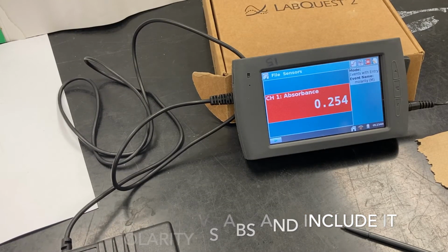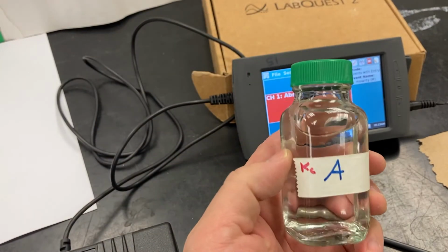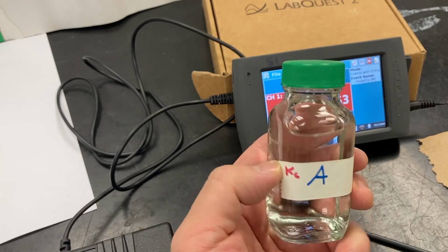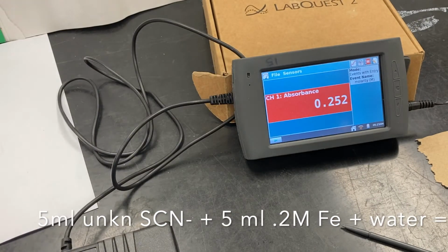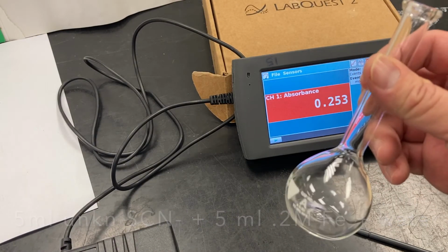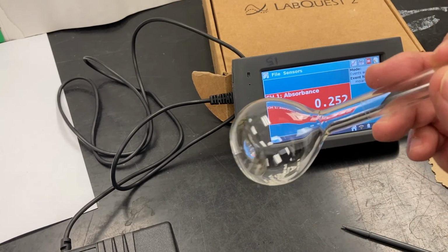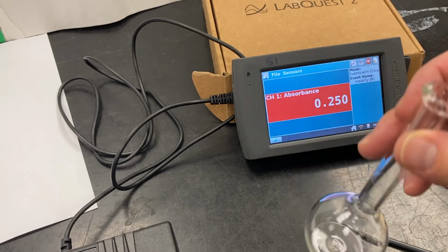Okay, so in part 2, we are going to make an unknown solution from this SCN solution of unknown concentration. We're going to take 5 milliliters of it, and we're going to combine it with 5 milliliters of the 0.2 molar iron, and we're going to make 100 milliliters of solution. We're going to test it and record its absorbance, and hopefully be able to determine what the concentration was using the regression.